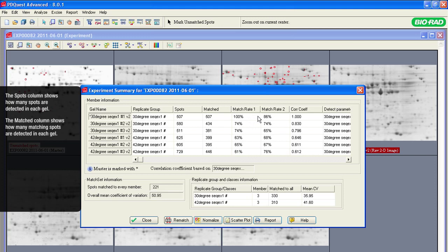This match rate allows you to review how well the spot detection and matching parameters were selected. For example, if one gel image is not matching at the same rate as the others, you might need to take a close look at the spot detection, normalization, and matching parameters for that gel to assess if the parameters need to be changed. The Match Rate 1 column shows the percentage of matching spots relative to the total number of spots on the gel image.